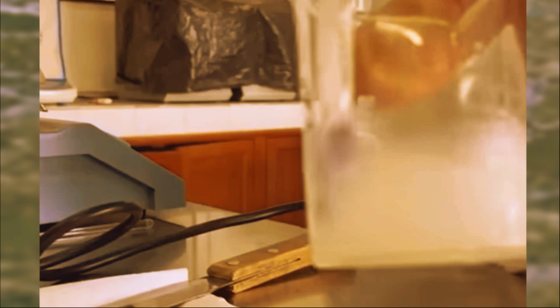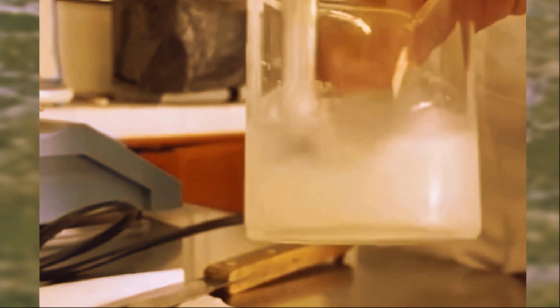The dried aspirin powder or granules are pressed using tablet presses, turning powder to pill. Using the tablet press is like using a giant stamp. They're pressing the aspirin powder into those familiar tablet shapes, and for the capsules, the powder is filled into casings made of gelatin. Step 8, quality control. Here the most important thing is to get the exact dose into each tablet or capsule. That is where quality control comes in.